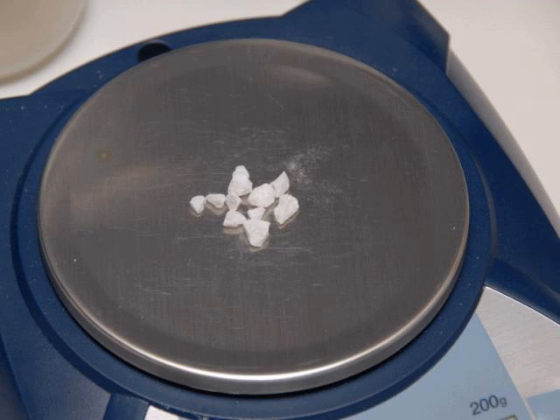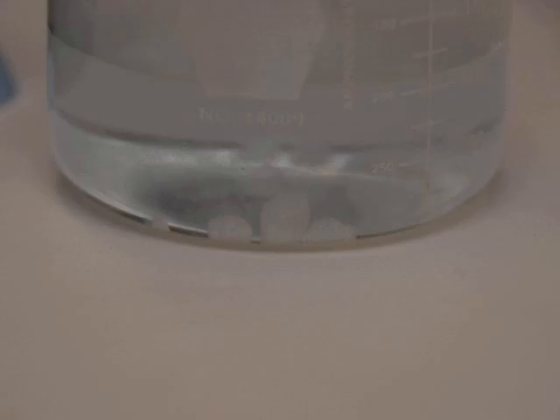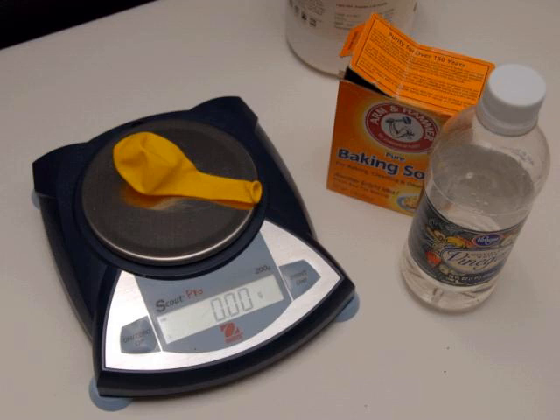Now, Michael Faraday, what he did to help his students understand mass was that he took some marble chips, and marble is basically calcium carbonate, and mixed that with some sulfuric acid, and the bubbles that were produced were carbon dioxide, and then he weighed this carbon dioxide. Now, sulfuric acid is a little bit dangerous to work with, so we're going to do something similar.